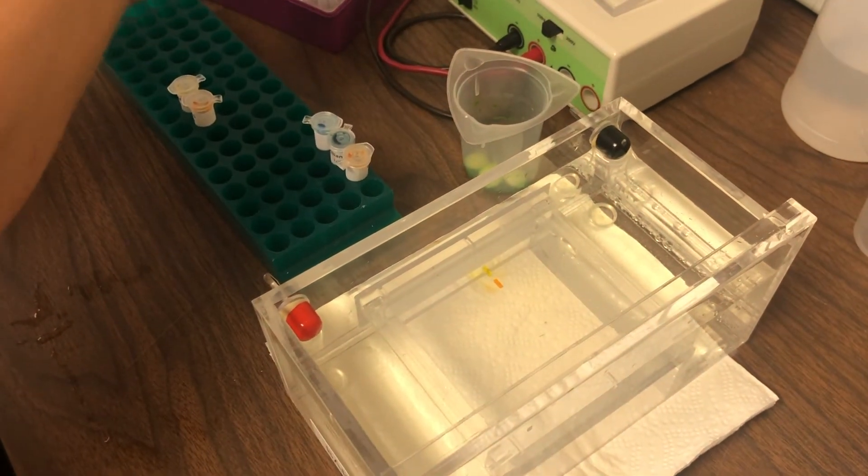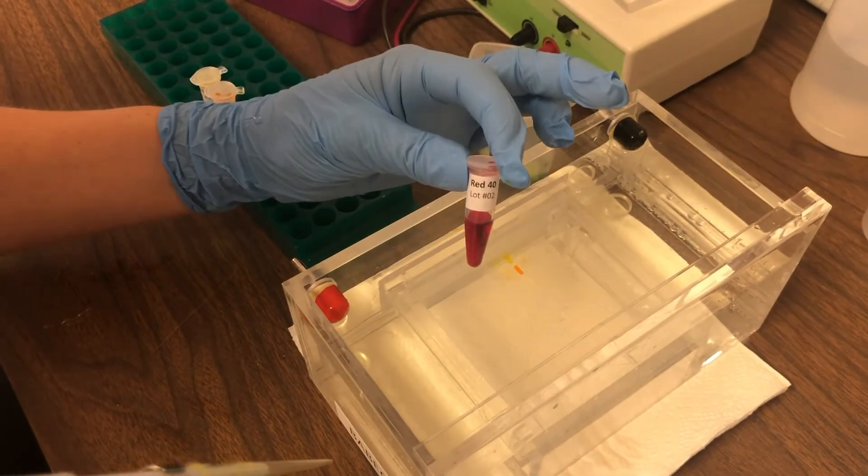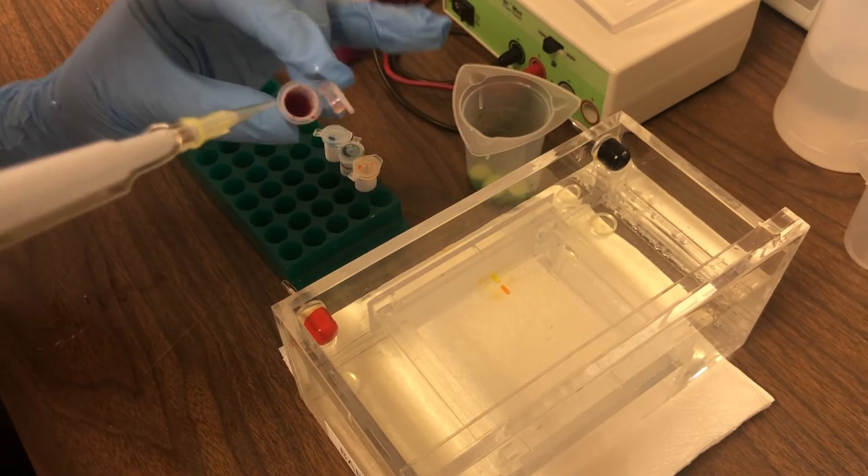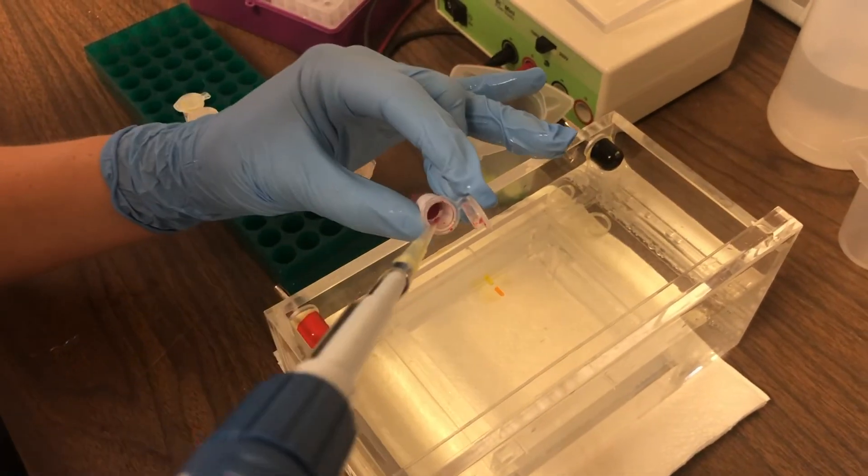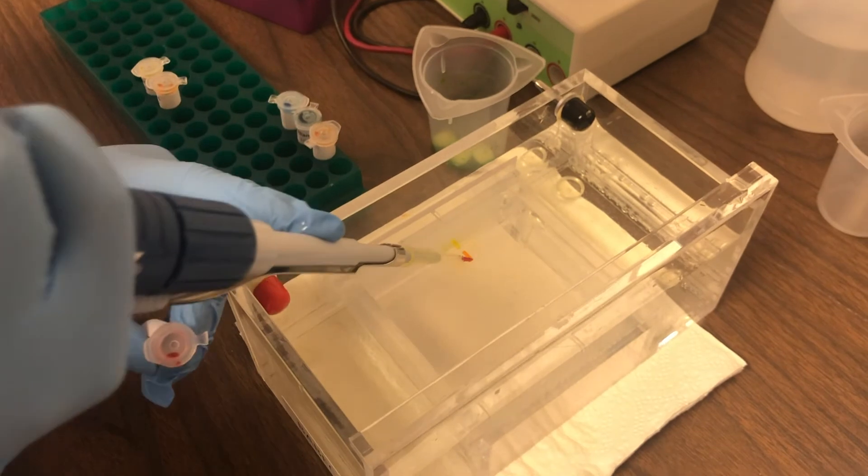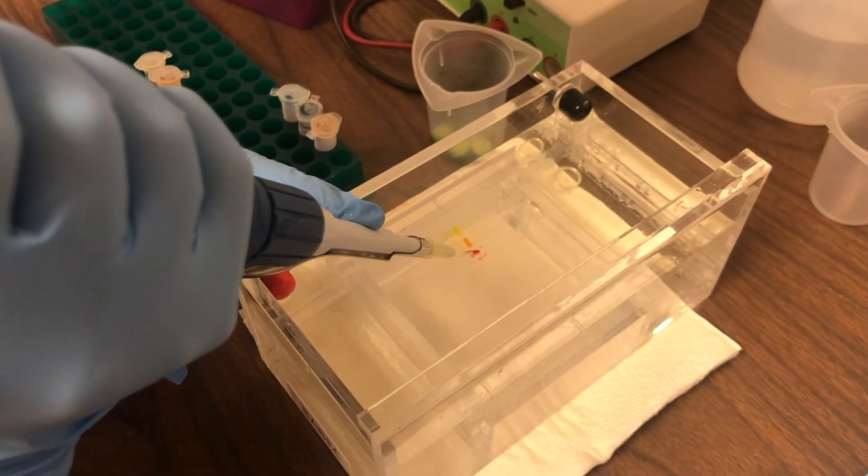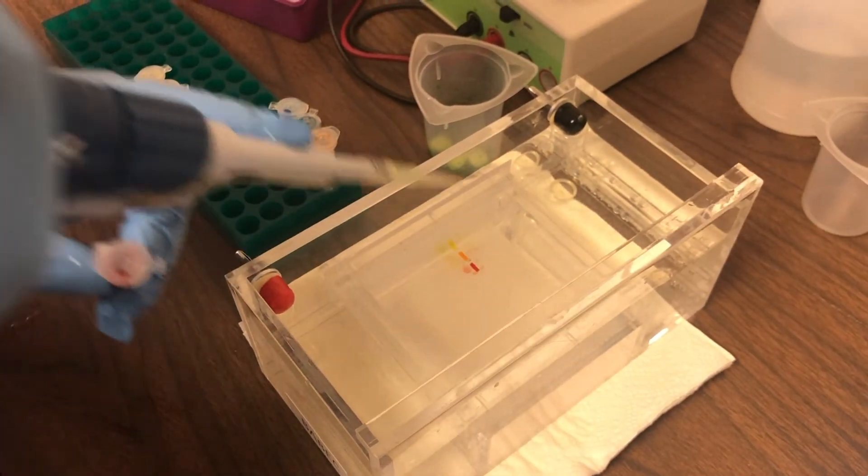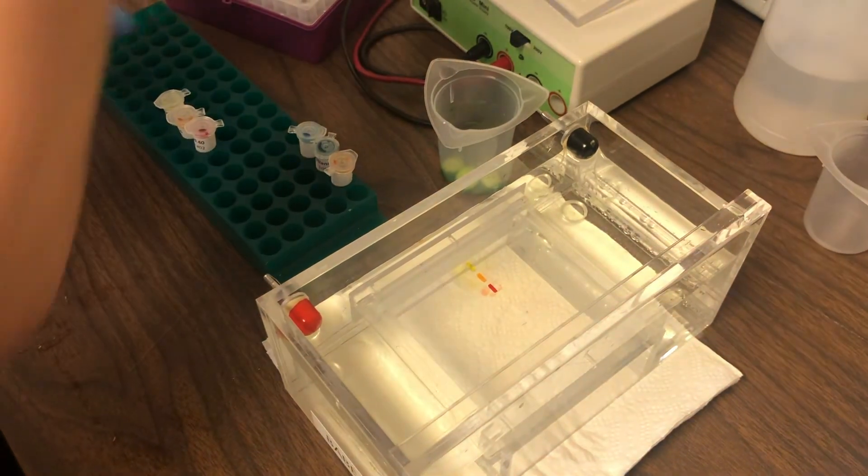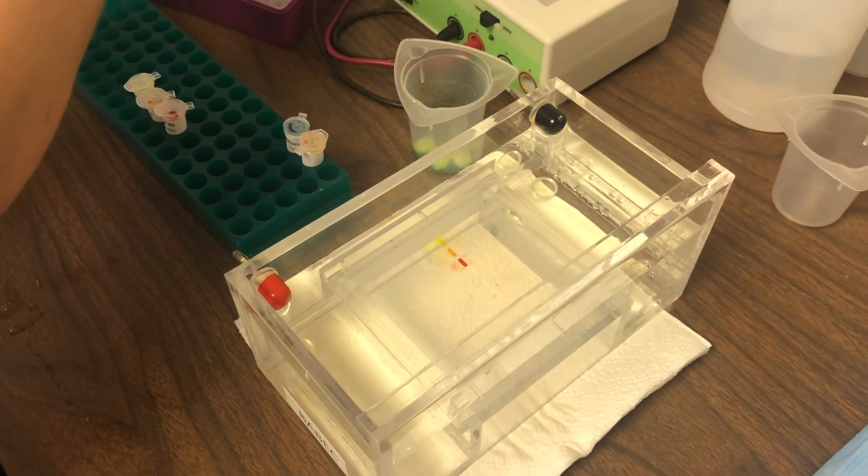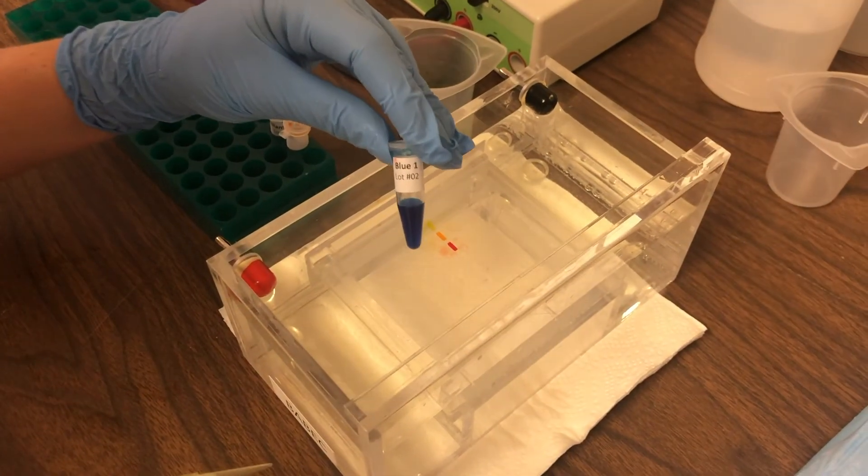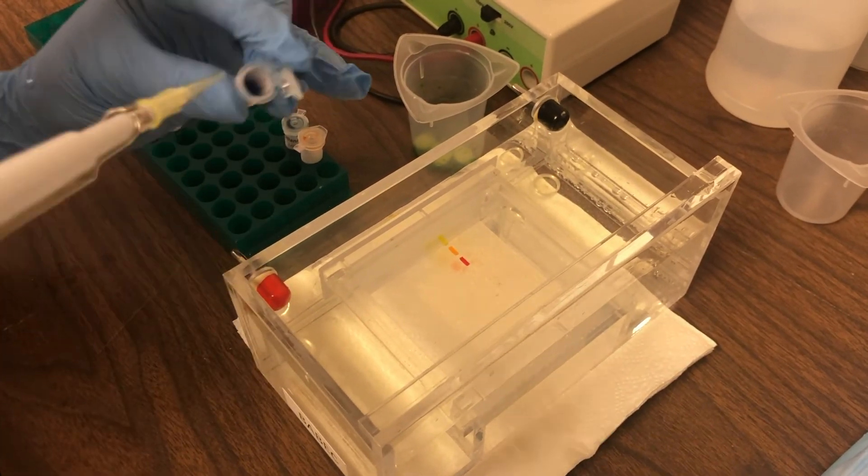Again, we switch our tips and move on to our next sample. When you're loading your samples, you don't actually put the tip way down into the well. You don't want to puncture the bottom of the well because your sample will go through the bottom of the gel. You actually hover it just a little bit over the top of the well before loading it.